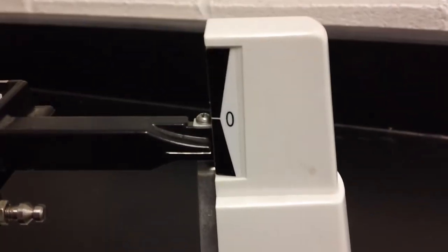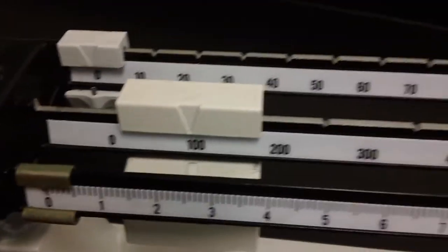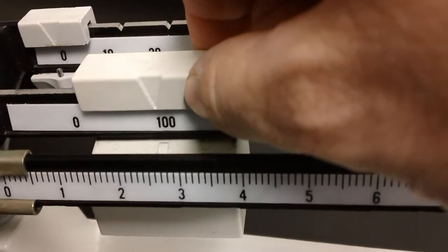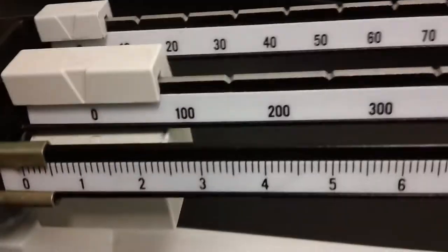Now, as you can see here, this is not balanced. In fact, what we know is that this is too much mass. So we know that one hundred is too much, so I'm going to slide that back to zero.